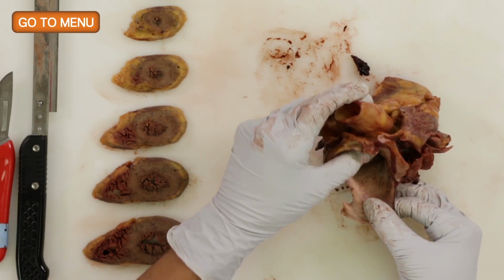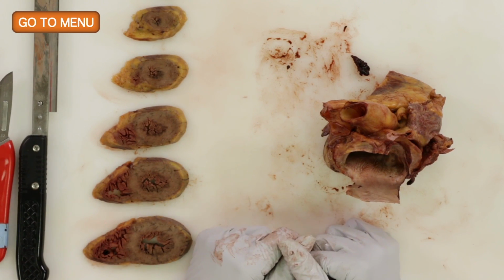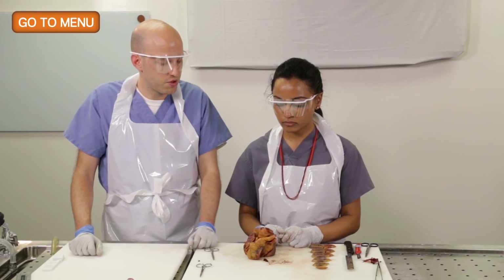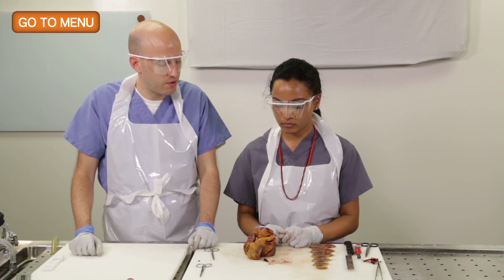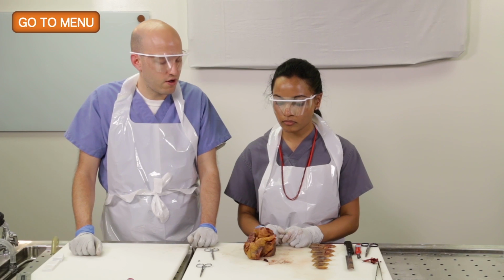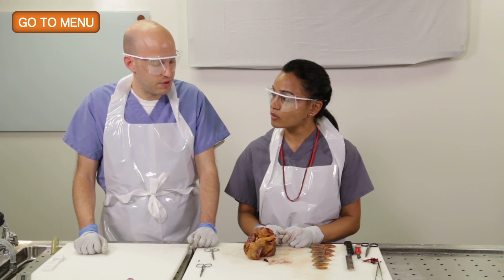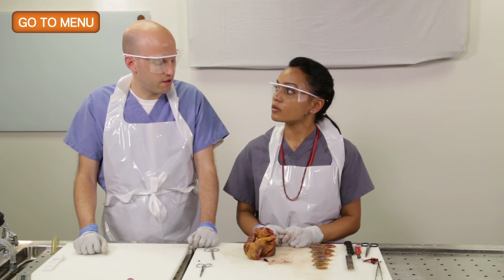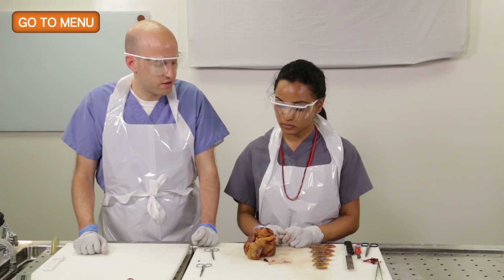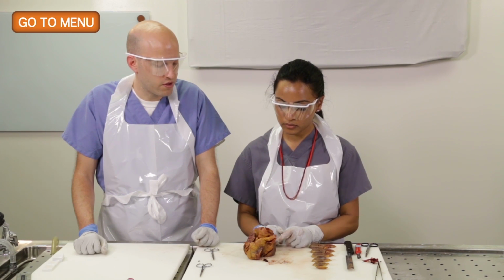And this next cut is the one that, if you read different sources, they'll tell you to do it differently. Some literature will say along the septum posteriorly. Some will say along the lateral border of the left heart. I like to do it right in the center, like 45 degrees between the septum and the lateral border. However you do it, you're going to see the valve, so it's not wrong, but it's just kind of up to your preference.